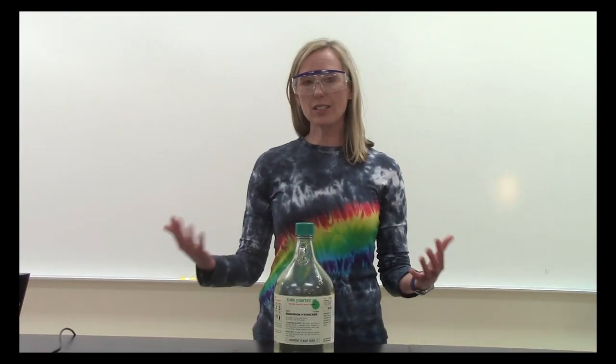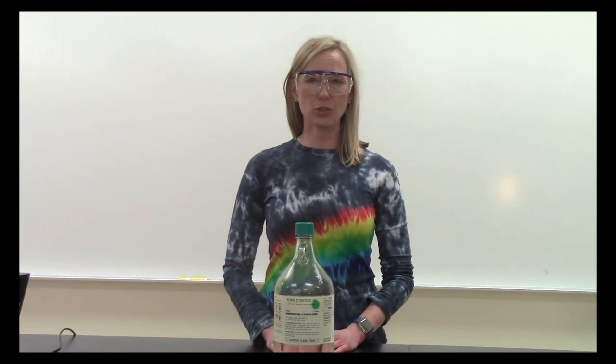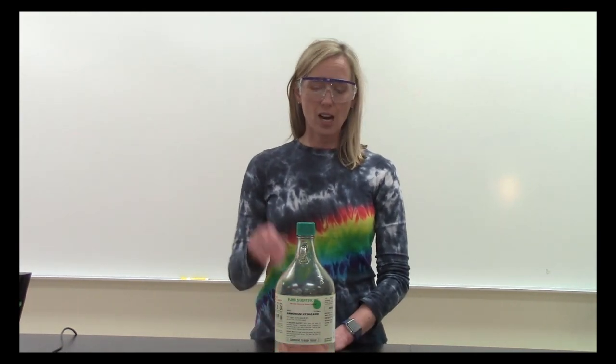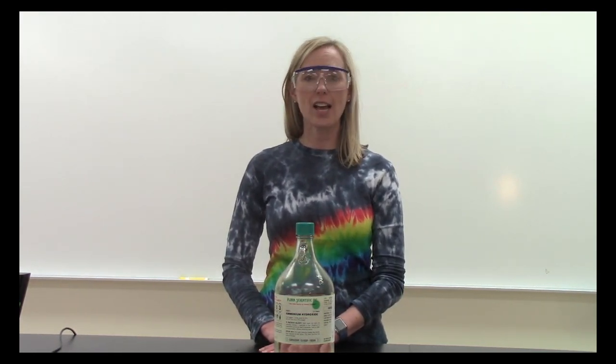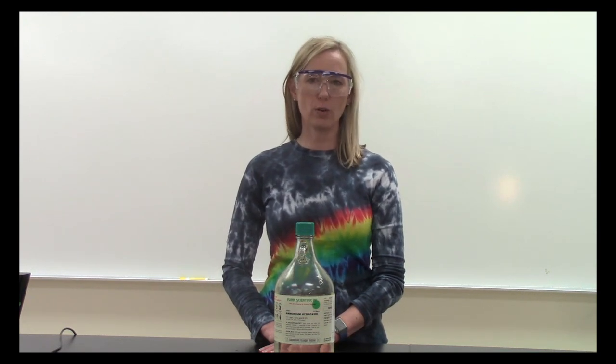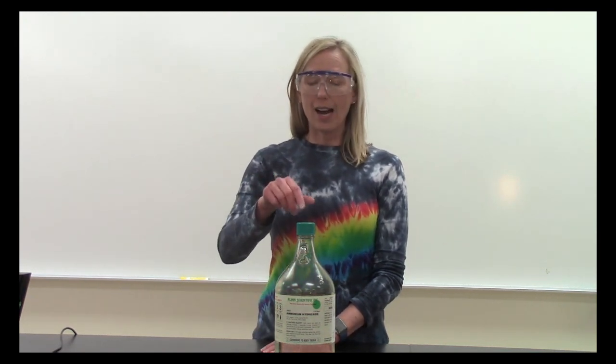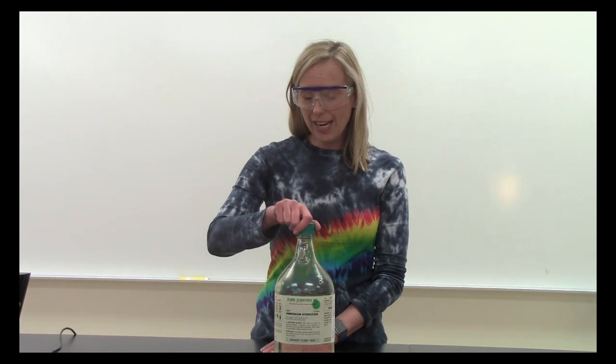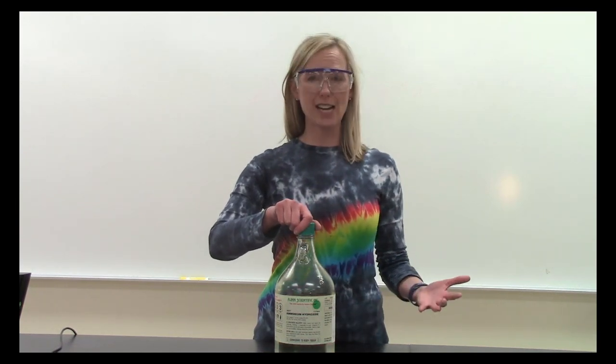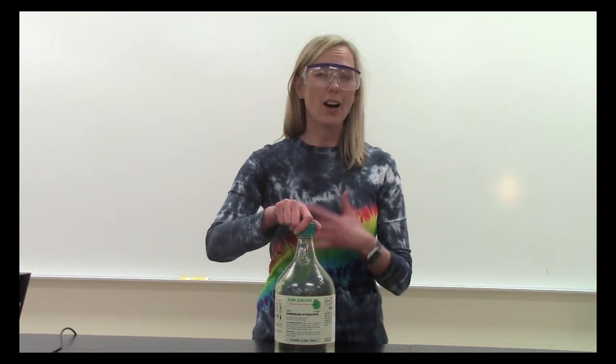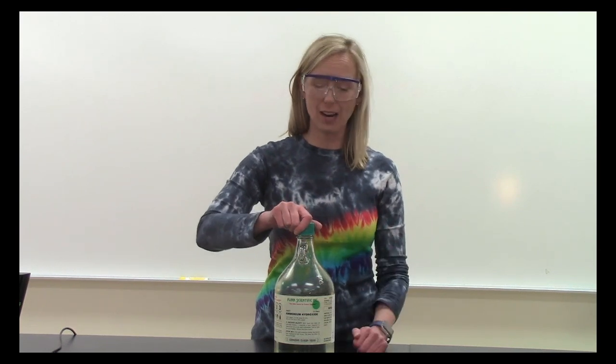So this is a little bit odd for a demonstration and I'm really not going to do anything snazzy but I wanted to show you a bottle of what's called ammonium hydroxide. The formula is NH4OH. I'm going to lift the cap off and just kind of show you my reaction to the smell of whatever's coming off of this chemical. Are you ready?